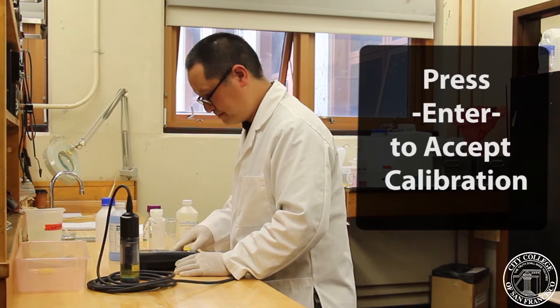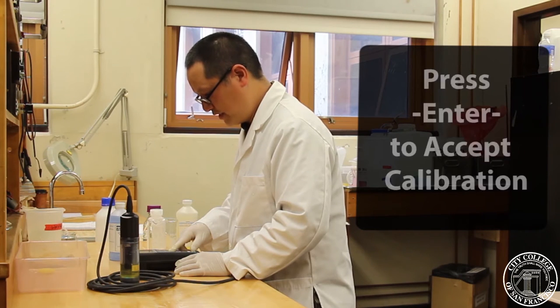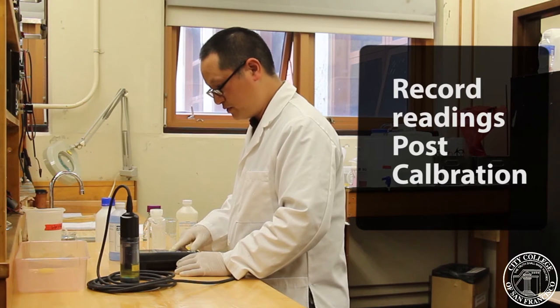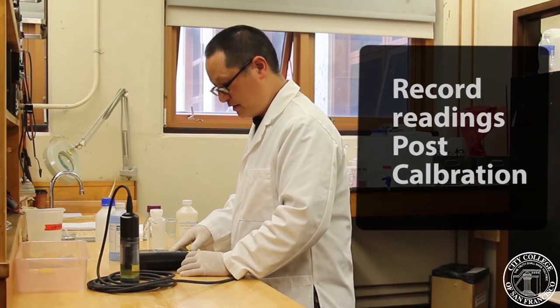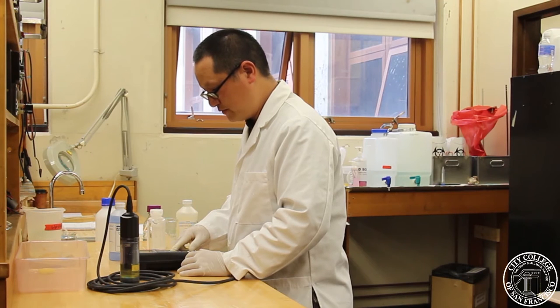We'll press ENTER. And it'll say press CAL to finish or press ESC to abort. We don't want to do that now. What we want to do is record, again, the actual readings post-calibration. It shows ready for point 2.